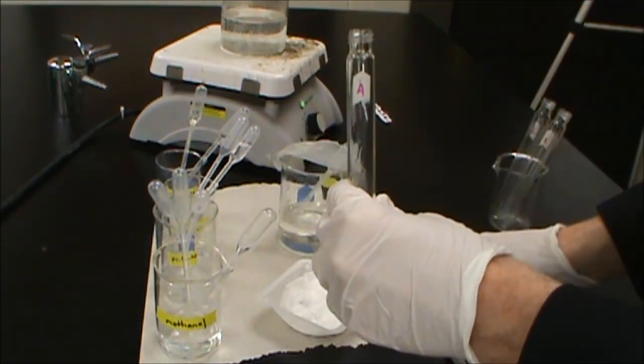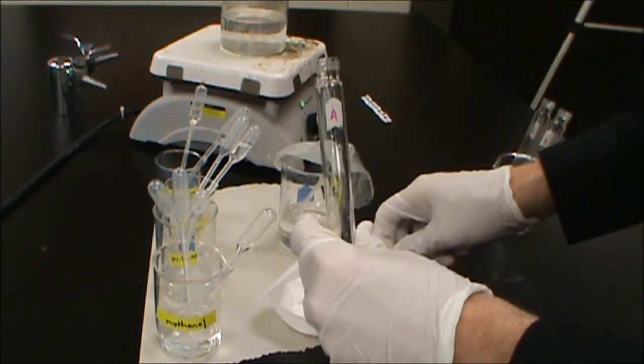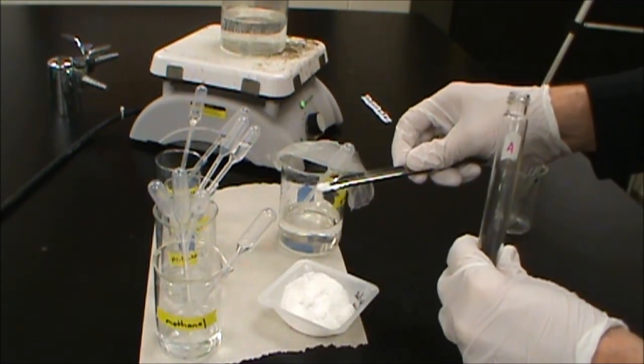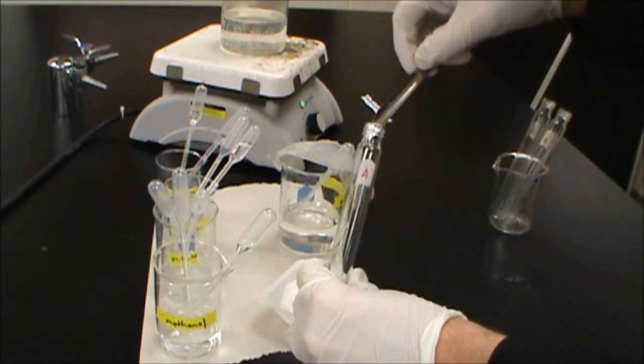So we have our methanol at the bottom there. Then we're going to take a pinch of salicylic acid. So esterification is always going to be about that size amount. It's supposed to be 0.1 grams. We're going to hope for the best there.